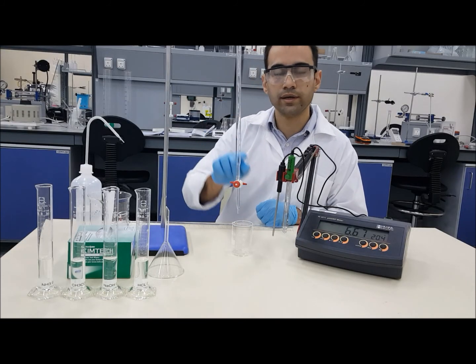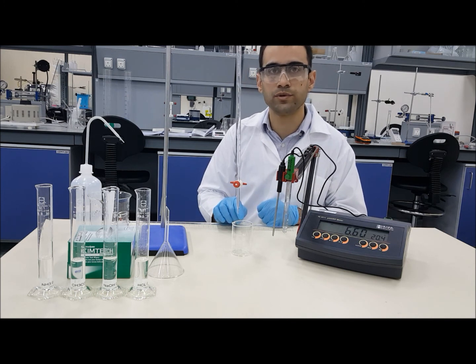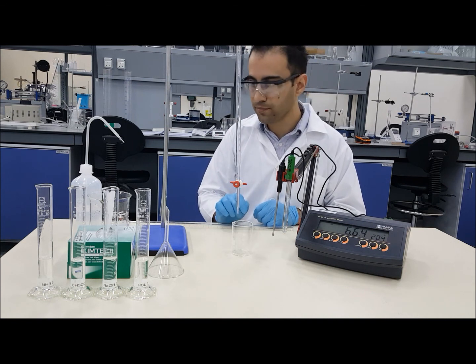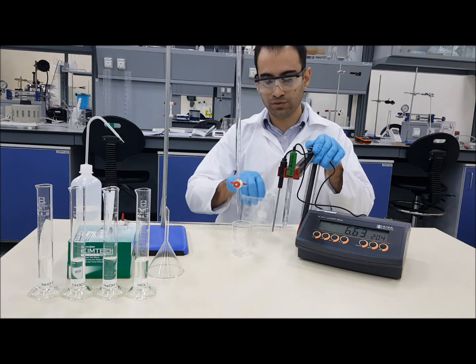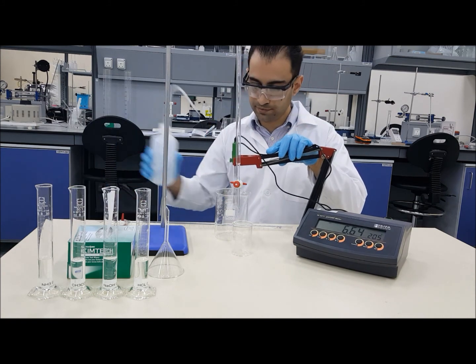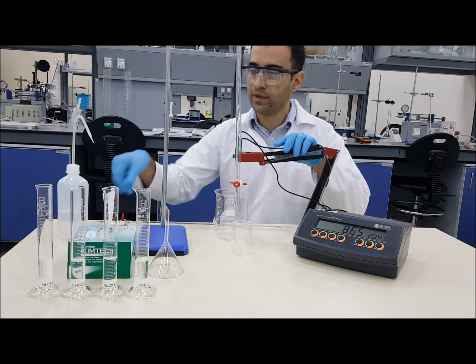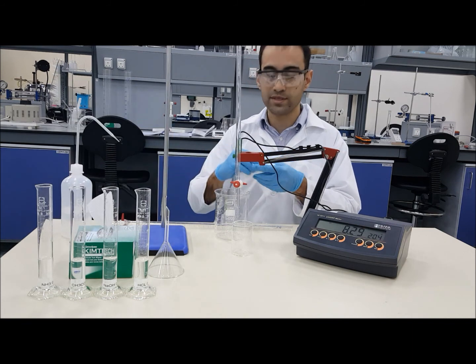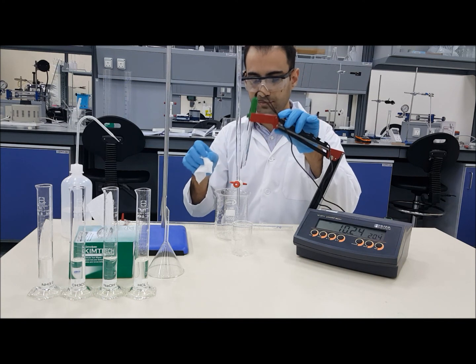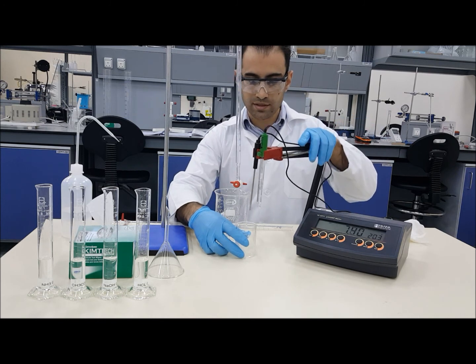The volume we are adding depends on the pH readings, so always refer to your lab sheet procedure in order to know how much exactly you have to add at each step. Before we start, we'll need to make sure that the pH meter probes are ready for measurement by washing them both, and you can always start this experiment with pH meter calibration. We'll need to get both probes inside this small beaker.